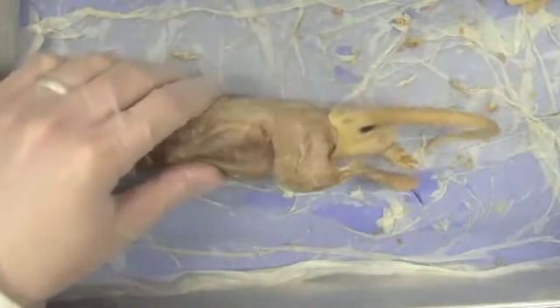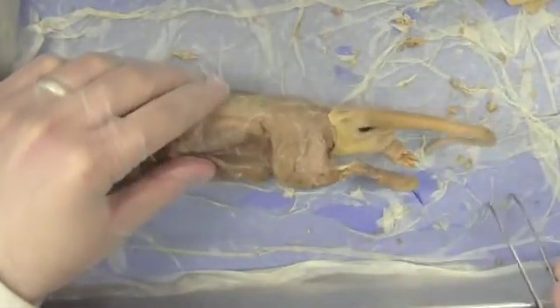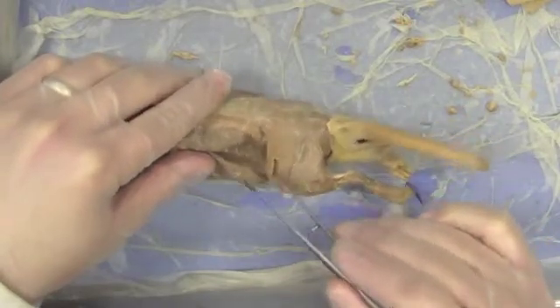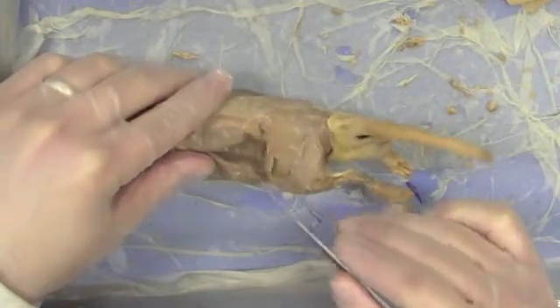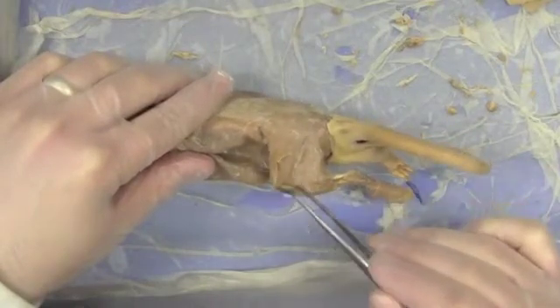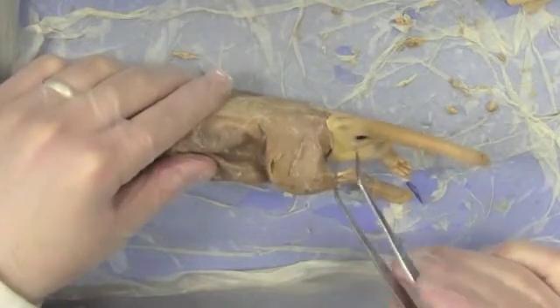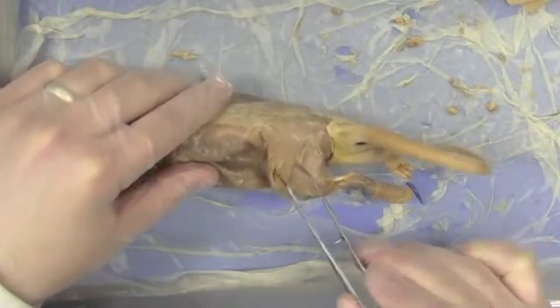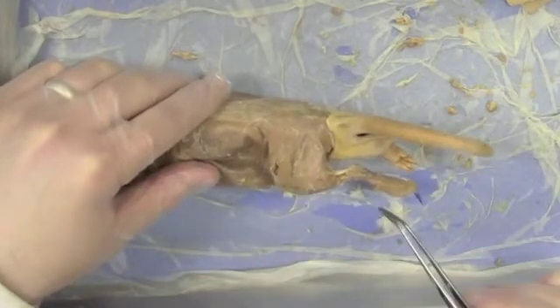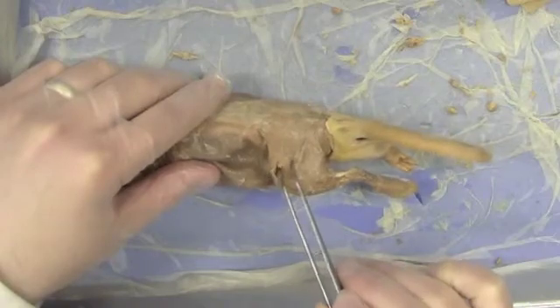Moving then to the leg, on the outer surface there are a few muscles that are easily visible. The first one here is the tensor fasciae latae, which comes off of the iliac crest and comes down to insert into the kneecap, or the patella. Underneath the tensor fasciae latae is the vastus lateralis — you'll recognize that as one of the quadriceps muscles.